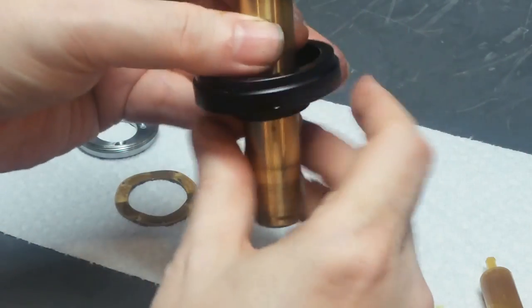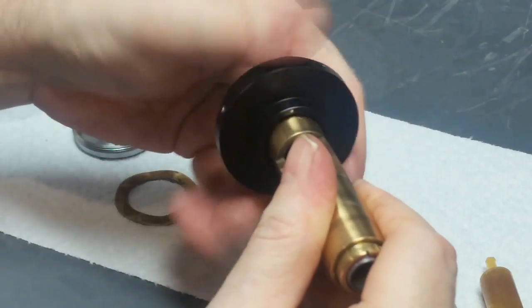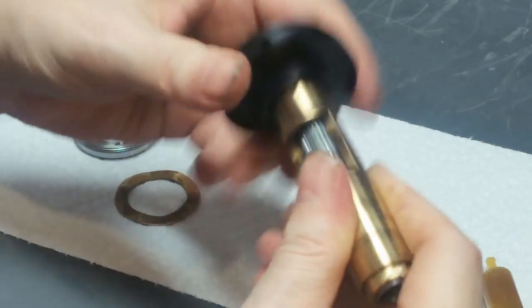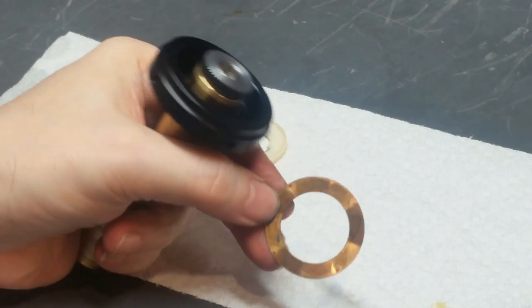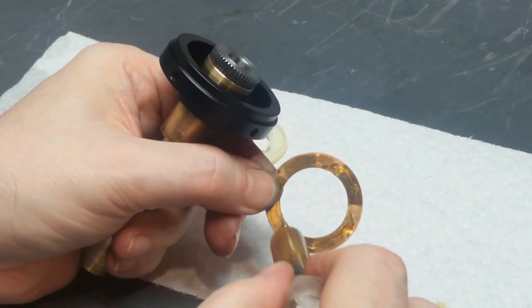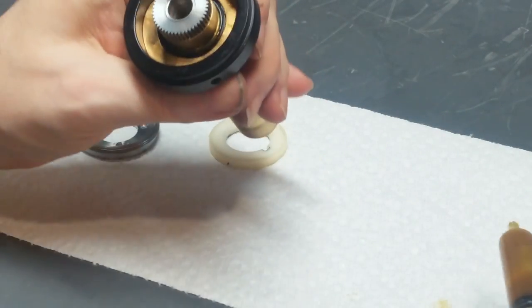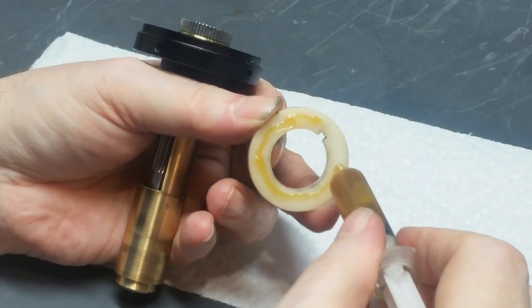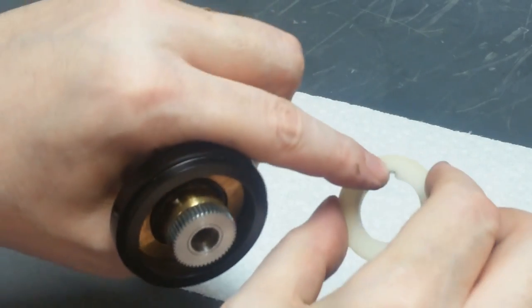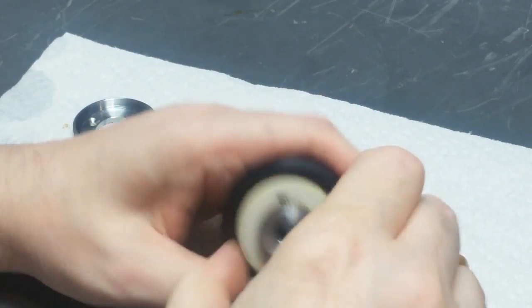Next thing I'm going to do is thread this thing on. Ordinarily you would thread it on this way, but these are left-hand threads. So the world is backwards. Close enough for now. Take this wave washer, put some grease here on the high points. Drop that grease in, grease down inside there so it'll stay in place. Now what I want to do is take this plastic thrust washer, grease one side of it. There's a little notch in this washer that aligns with that little pin. Ideally it does, if you can get it to drop in there.